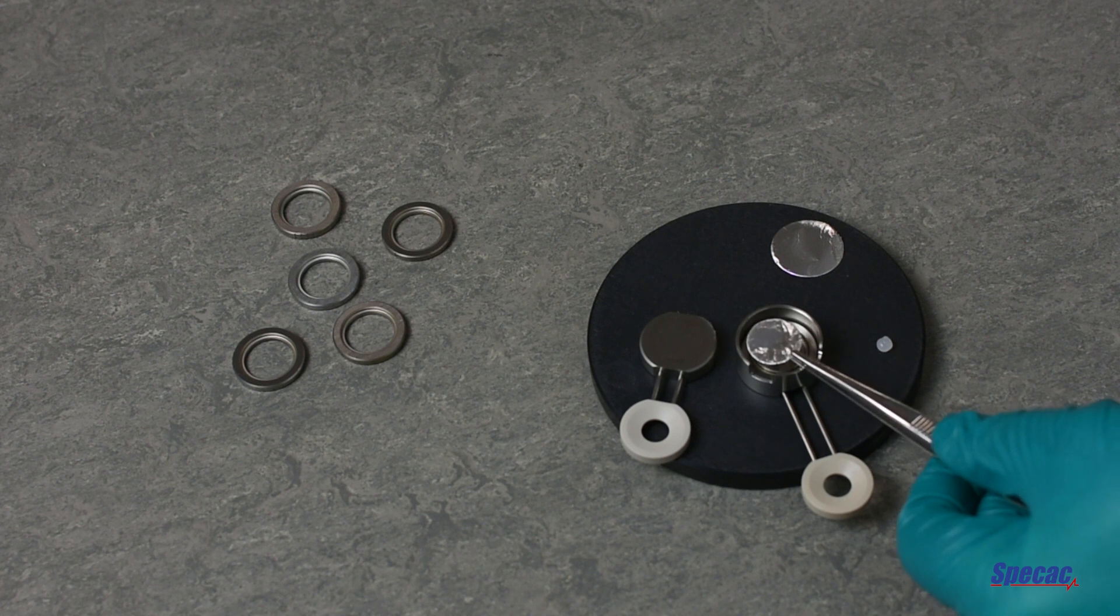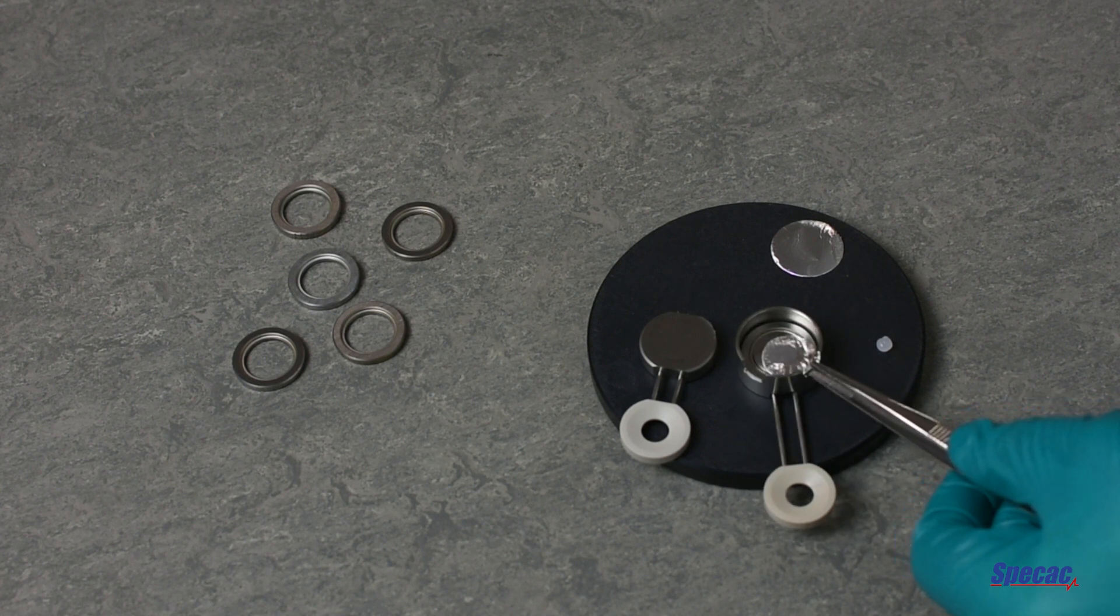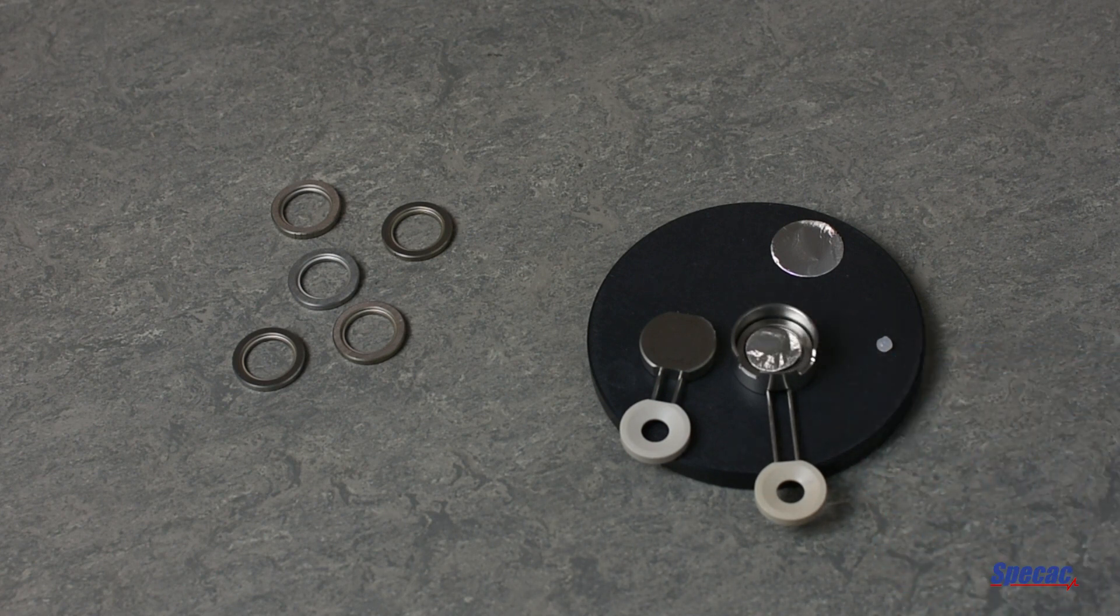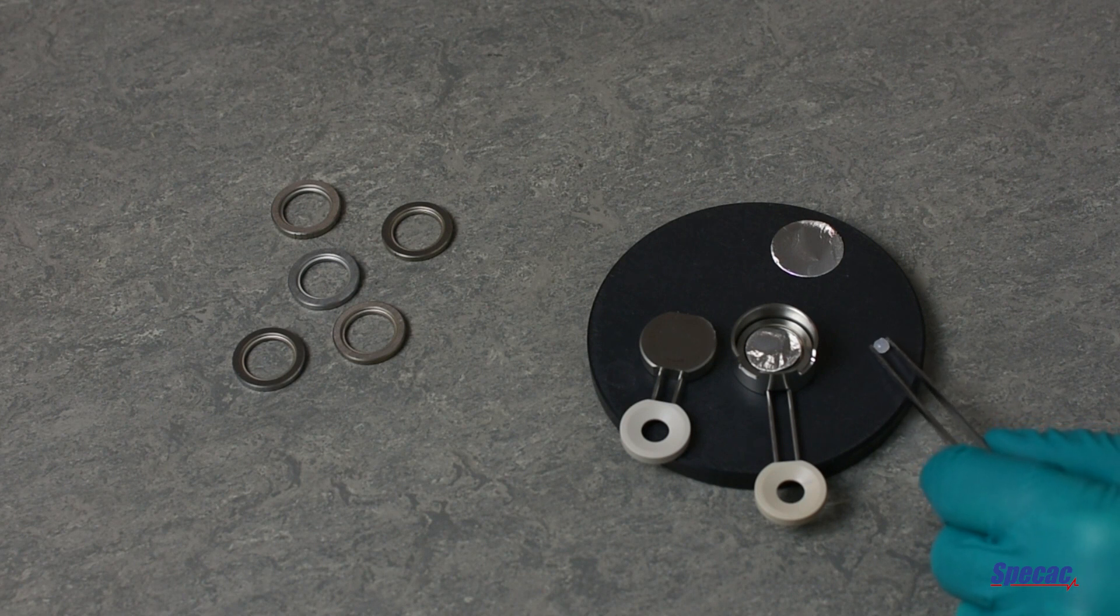Next, a small diameter foil is placed into position. The sample is placed carefully and centrally onto this small diameter foil.